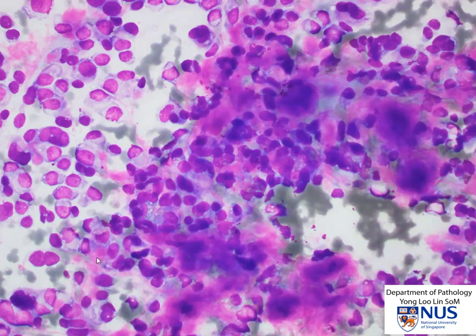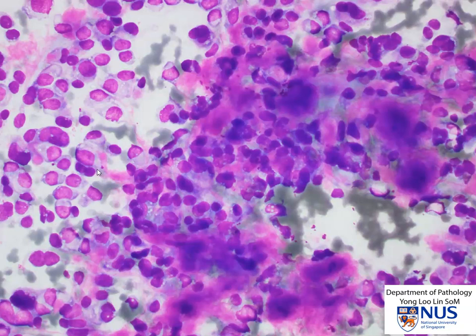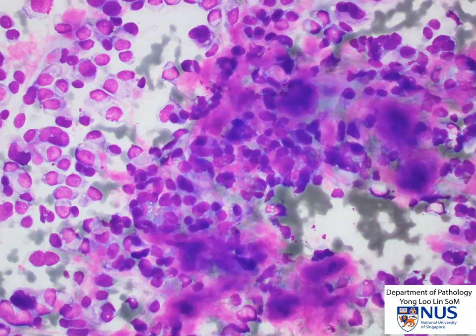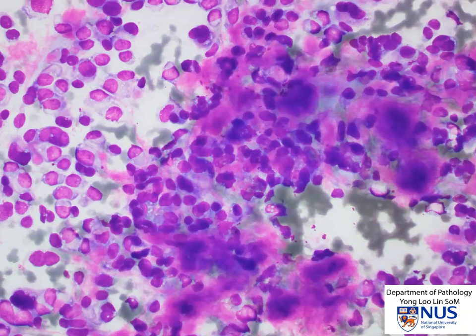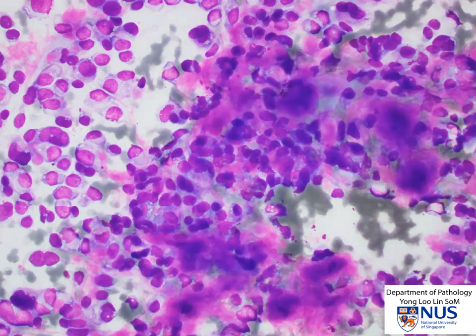In summary, the cytologic features of medullary thyroid carcinoma are a spindle cell or epithelioid or combined spindle cell and epithelioid appearance, binucleation, and very importantly, salt and pepper stippled chromatin, the absence of colloid, and the occasional presence of intranuclear pseudoinclusions and amyloid. The diagnosis can be confirmed by ancillary testing on cell block material.